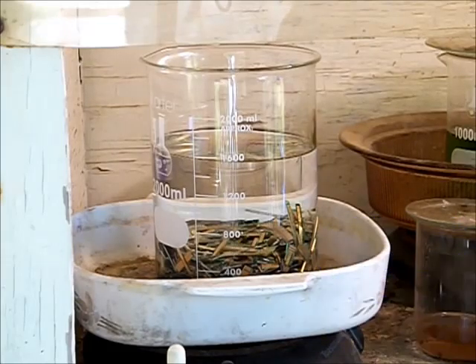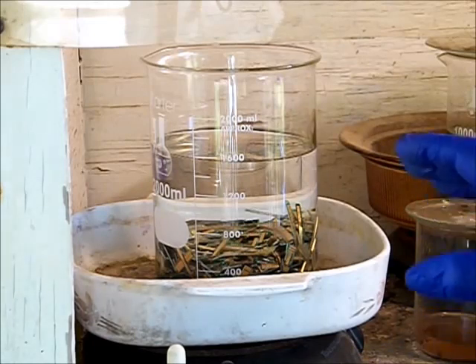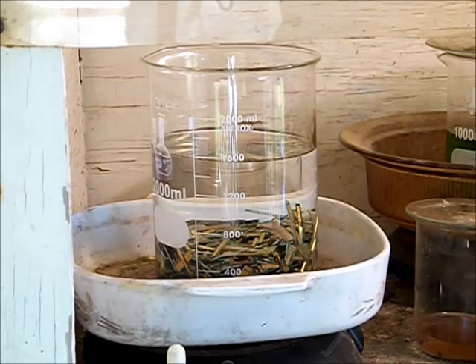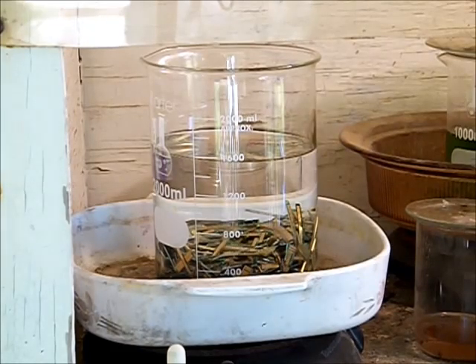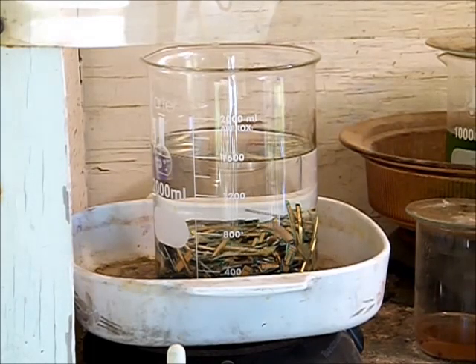Everyone's process could be different. You have to use whatever suits you best. Different nitrate salts you can use: potassium nitrate, sodium nitrate, just about any other nitrate except for calcium. I don't recommend calcium nitrate because when you add sulfuric acid to calcium nitrate it forms calcium sulfate, which is basically drywall gypsum.